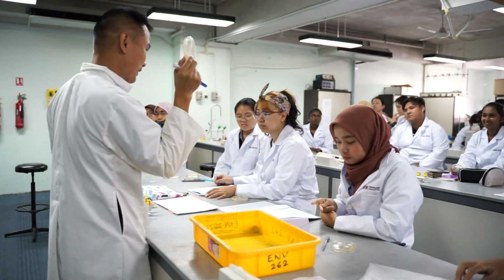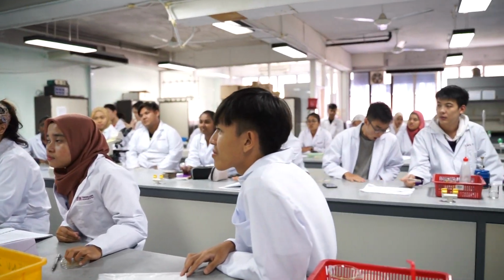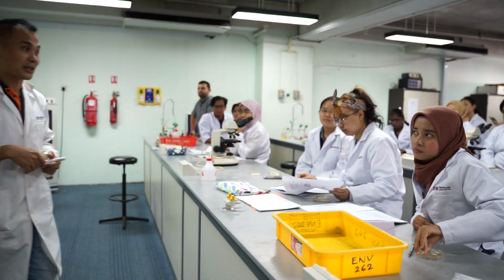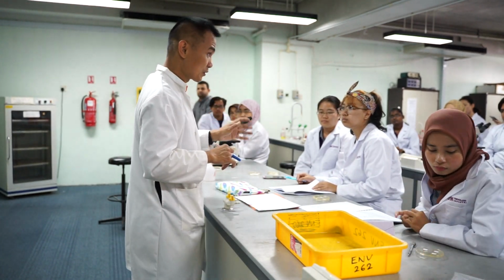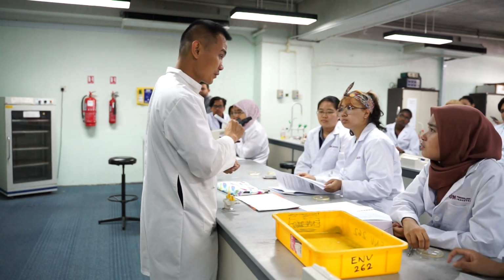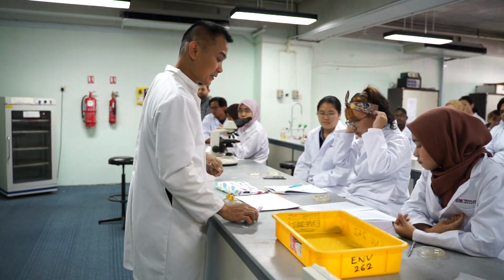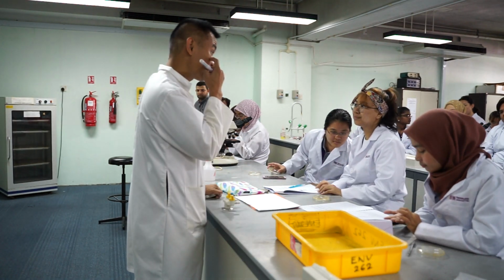sample from last week. Okay, so you already have a combination of bacteria. You're going to isolate them into single culture today. Okay, so that is the first step. Okay, that's what you're going to do today, yeah? But unfortunately, you can only look at the results tomorrow because you need to wait until tomorrow for it to grow. So all of you will be given one plate. You need to do your own streaking. I'm going to show you how to do the streaking. And then, if you look at the lab manual, there is a link to the internet, the YouTube. You can learn from them. But I suppose none of you have seen it, right? I know.